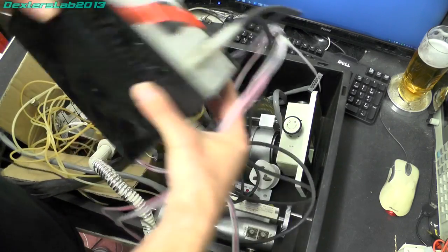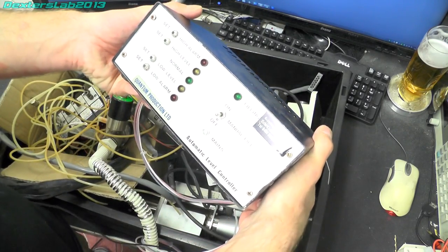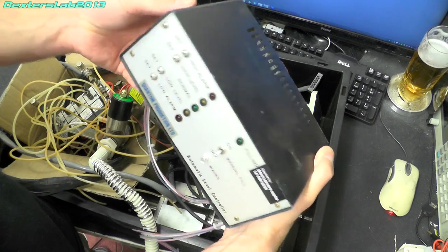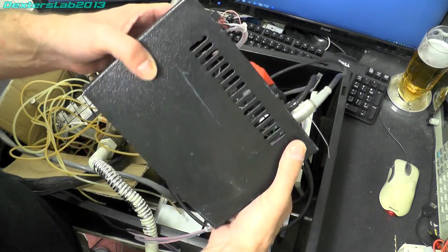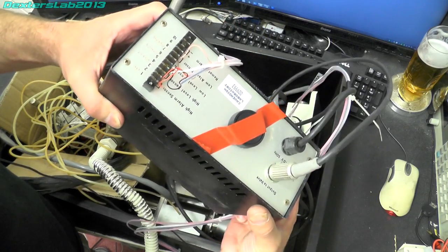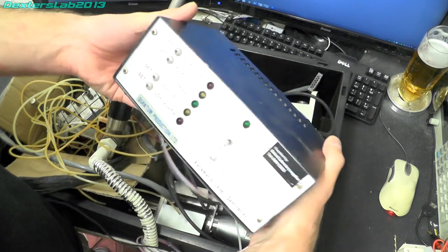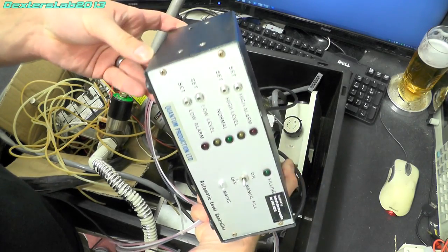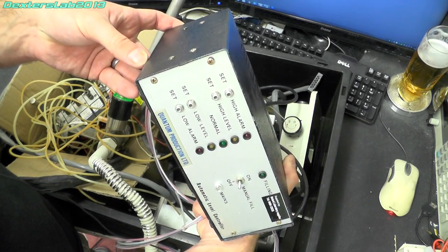So I think this is just acting as a really basic level controller for the liquid nitrogen in that baffle. So presumably a little controller that would open a valve or a pump or something and pump more liquid nitrogen into that baffle.